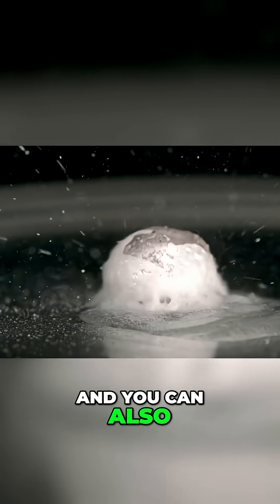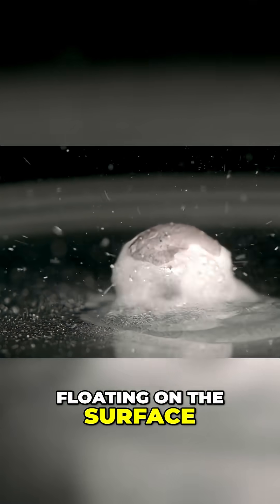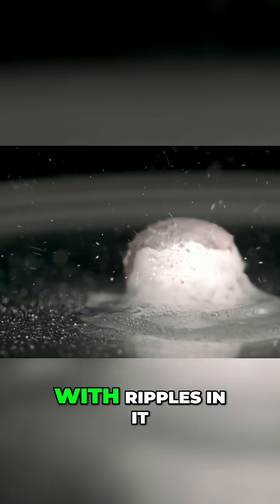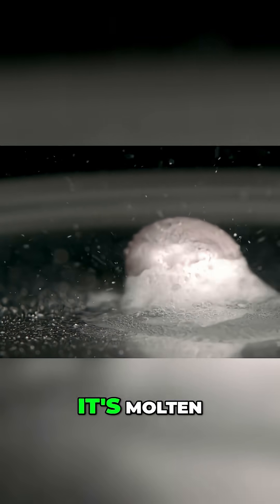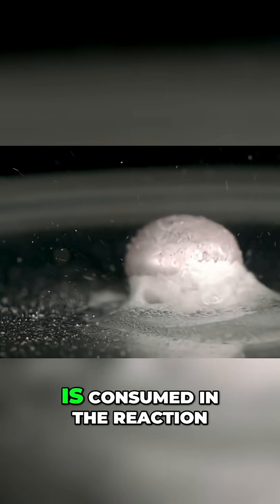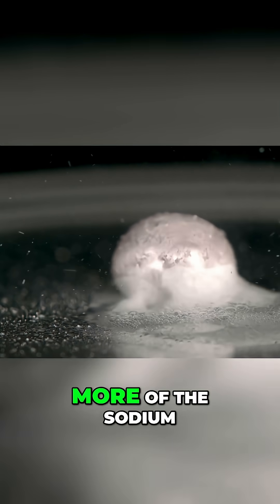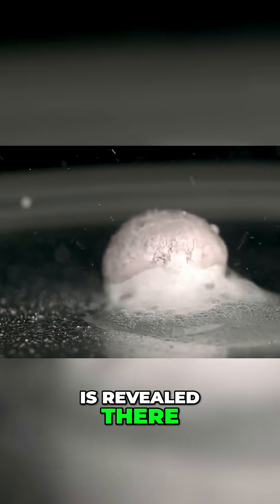You can also see the sodium is floating on the surface of the water. You can see a film of the sodium with ripples in it, so you can tell it's molten. And as the water is consumed in the reaction, more and more of the sodium is revealed.